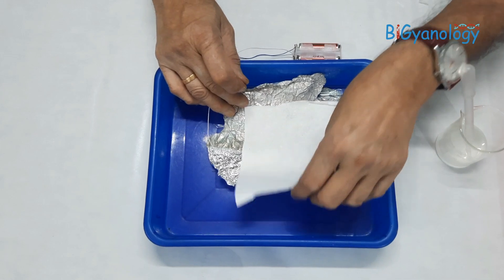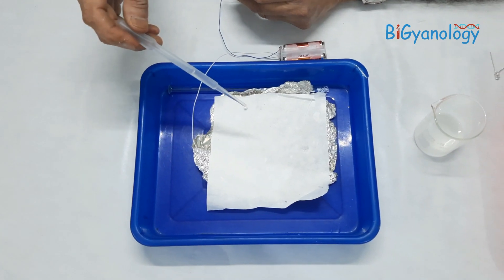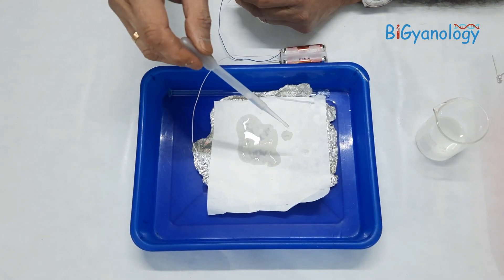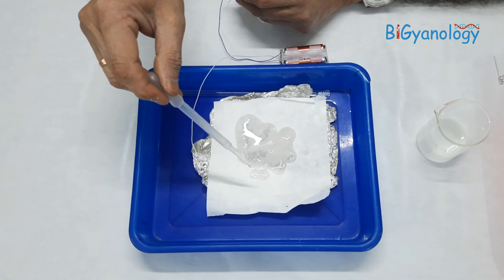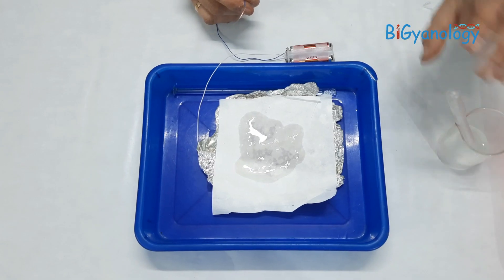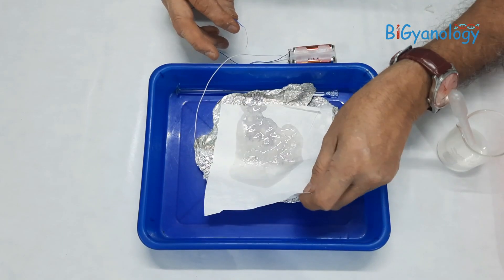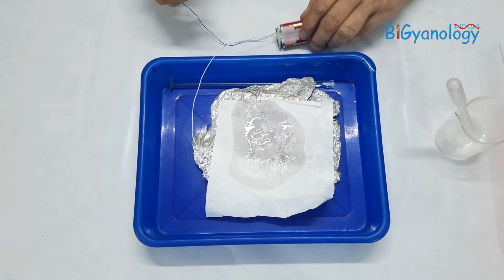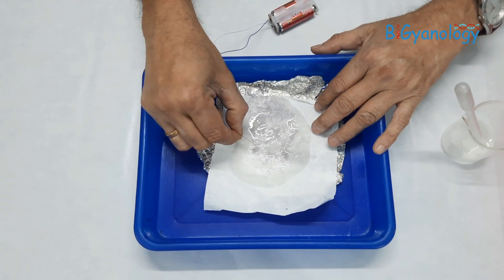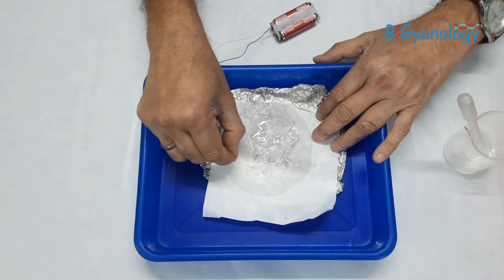We remove the LED and place the blotting paper on the aluminum foil. We wet this blotting paper with a few drops of the mixture of potassium iodide and starch. You should not add too much water — I removed some excess so it is just a little damp. Now, this wire above is the positive charge and below is the negative charge, so the moment we touch the paper it starts giving a black color.